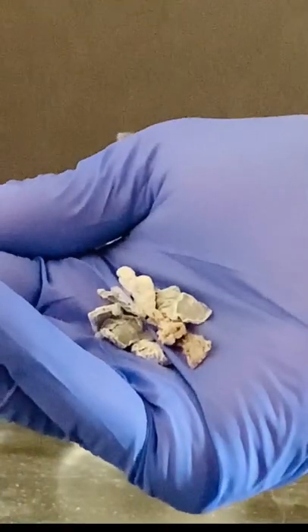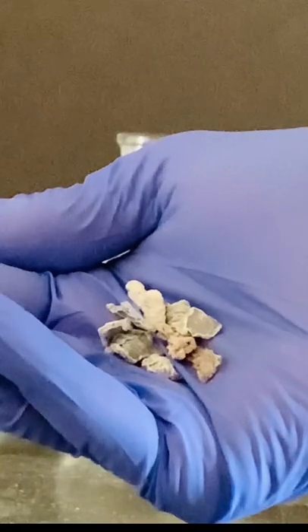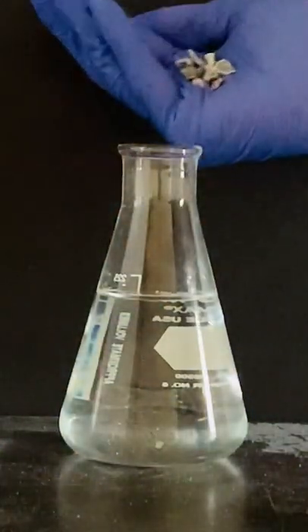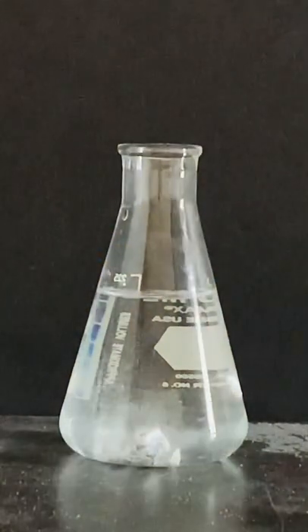This experiment features the chemical reaction between calcium metal, which I'm holding here in my hand, and water. Let's see what happens when we drop the calcium metal into some water.